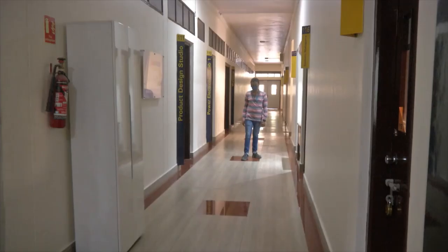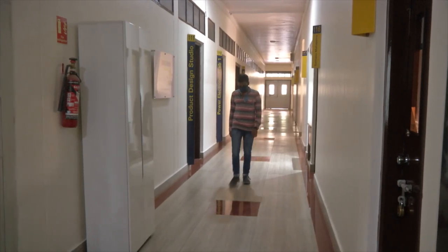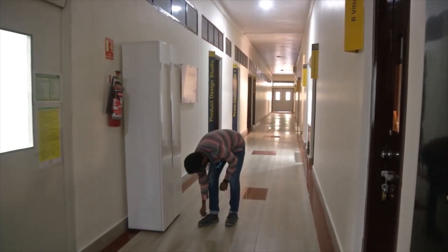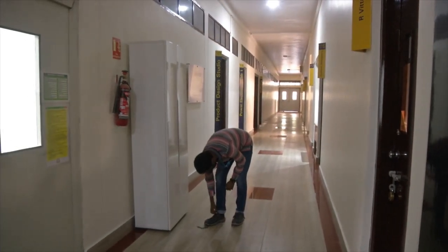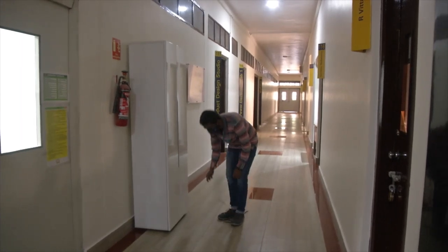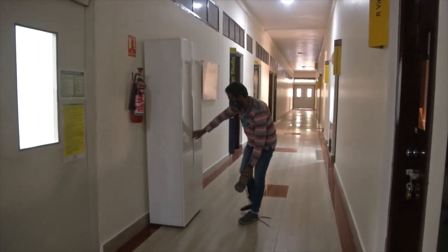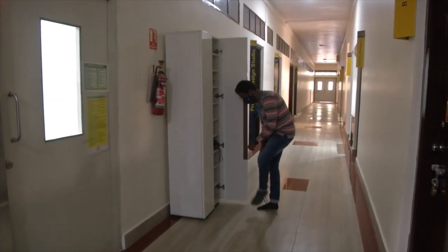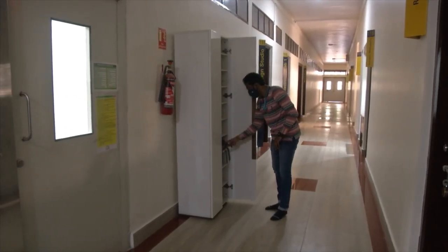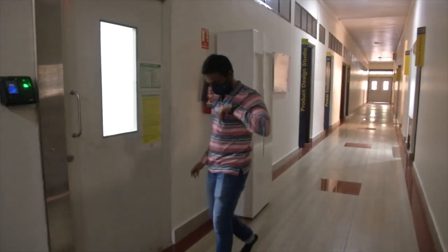The first step to enter a clean room is to remove your shoes. This reduces the extent of contamination. As you can see, he is keeping the shoes in a designated place. After removing the shoes, the next step is to access the clean room using a biometric entry.